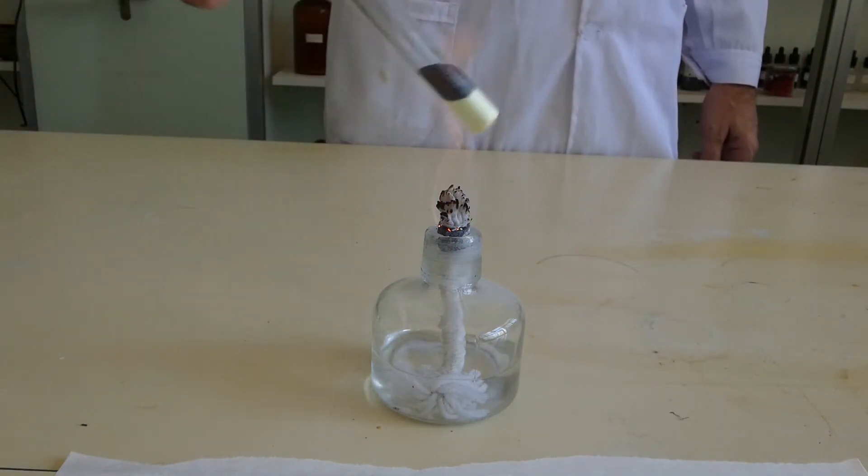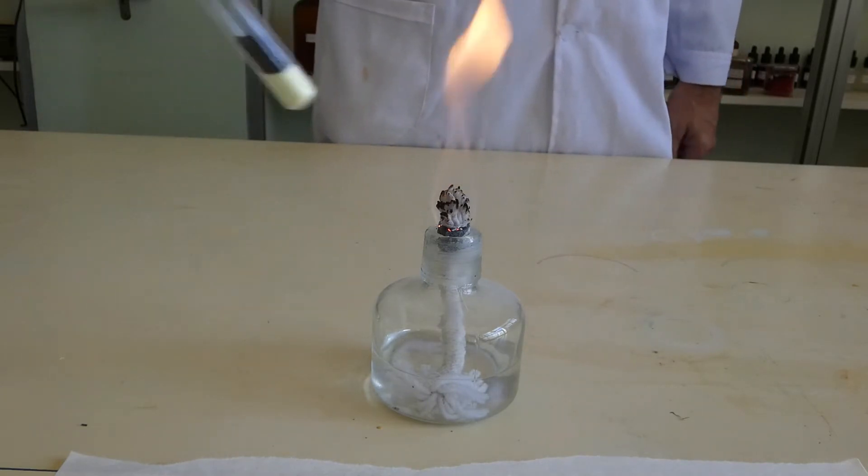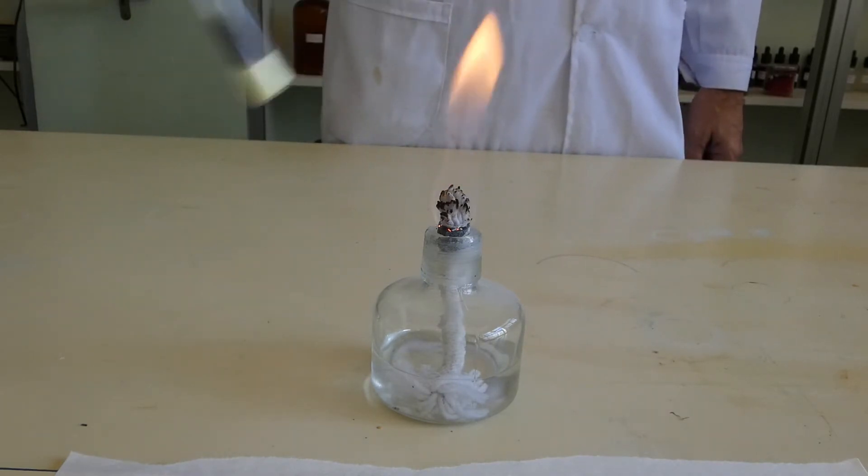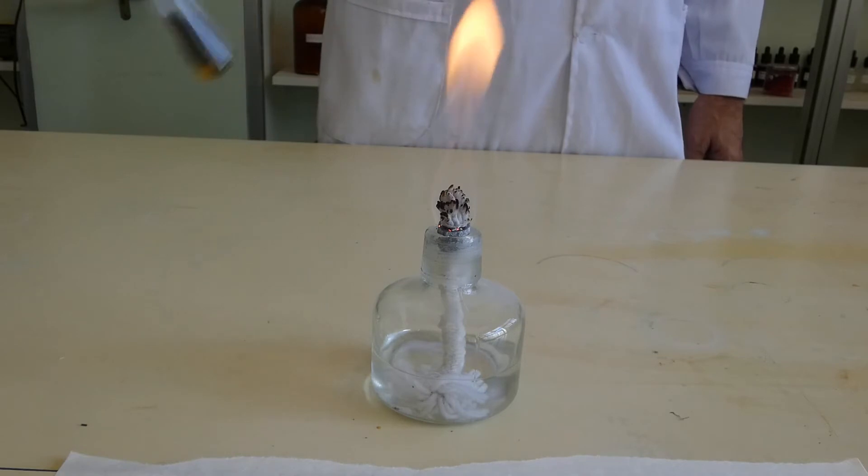To do this, you have to shake and remove. Shake to homogenize the mixture of composition and temperature. From time to time, remove the tube from the fire to avoid projections - that is, to prevent the contents of the tube from shooting out. It is changing color from brown to black.